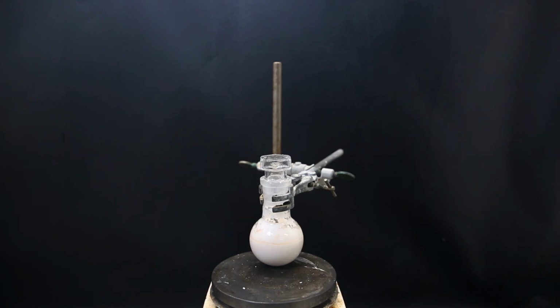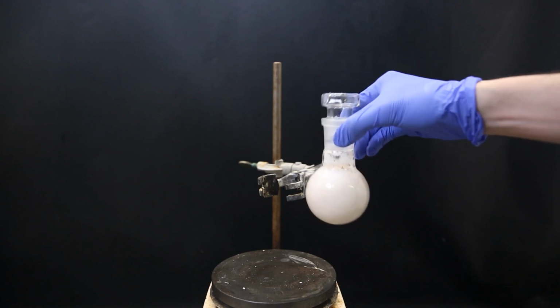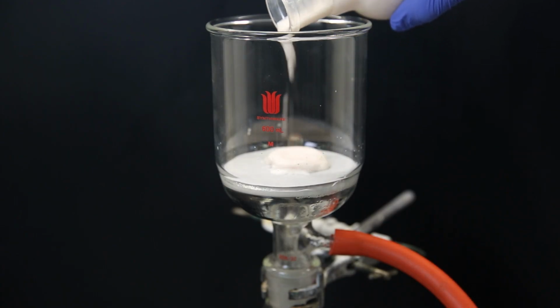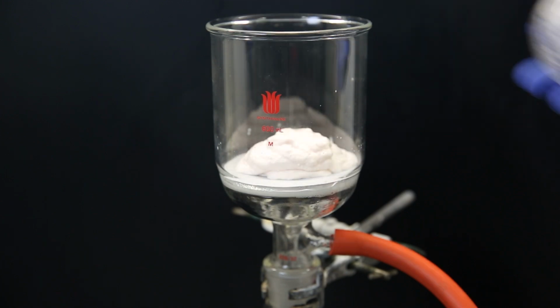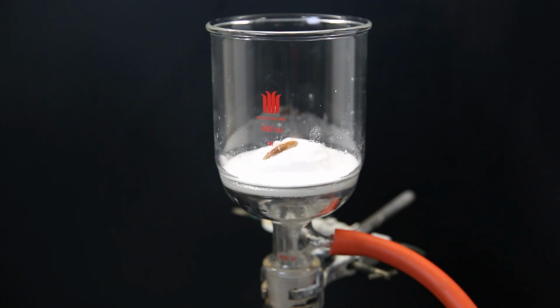When it's finished, the amine hydrochloric acid salt is in suspension as a white solid, while the non-amine impurities did not precipitate out and stay dissolved in the ethyl acetate. I then set up a flask and a glass filter with a paper filter on top and filter the mixture through while pulling a vacuum. I washed the flask and the residue several times with more ethyl acetate to get out all of the impurities.